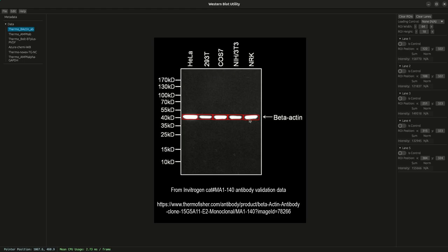So that is convenient, but also can be really difficult for really fine adjustments. And in that case, you have the fallback option of editing the raw pixel position over here on the right panel. So let's say I want to reposition this last one more carefully. I see that it's in lane 5. So I'm going to go to the Y position and I'm going to say I want to make this 2 pixels higher. So I'm just going to make it 322. And there you can see it's a slightly better fit.